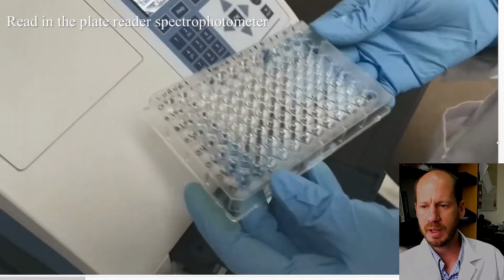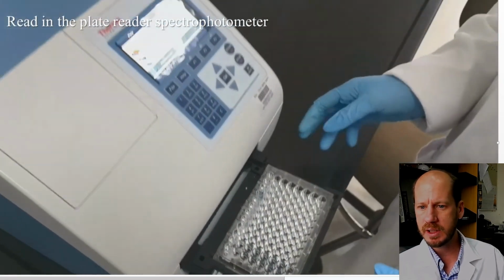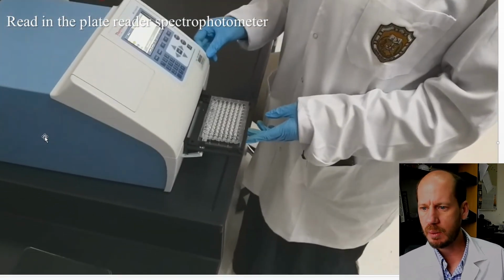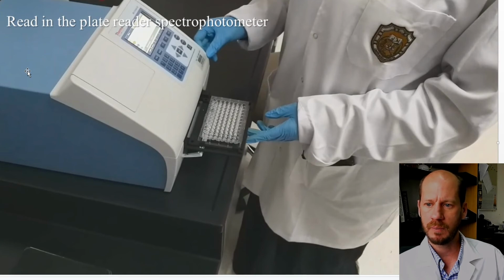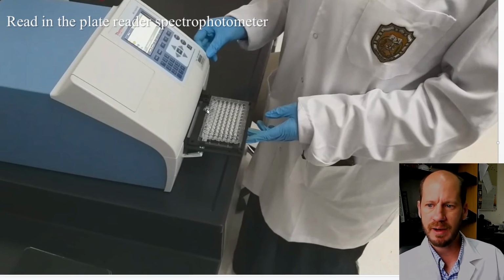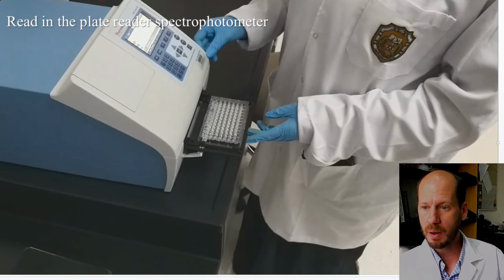The only thing is we have now to multiply by the dilutions we have, and then instead of dividing by the grams of soil that we used, we have to divide by the grams of dry weight of the plant material. So we have the total amount of phosphorus in the extract, multiplying by the dilutions and by the total volume of the extract, and then we divide by the number of grams of dry weight material we have before ashing, and then we're going to have this concentration as milligrams per gram of plant material.